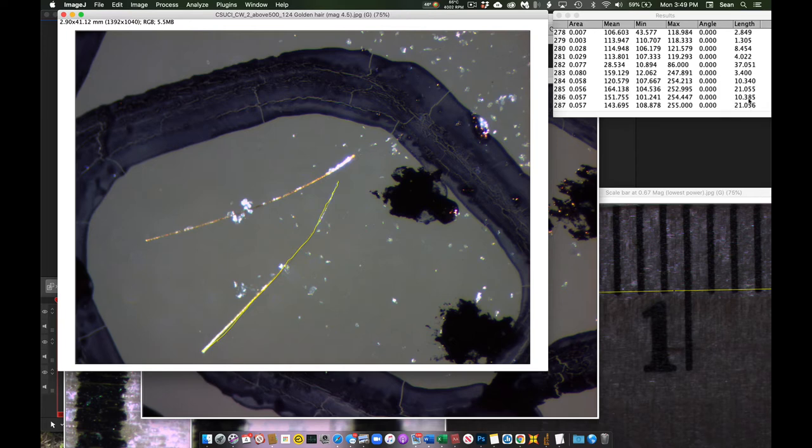And so I'm concerned that this might have introduced a significant amount of error to our microplastics measurements of late, at least mine on this computer. And I'm not entirely sure what's going on. I've checked the forums, but I can't find a ready answer for why getting such massively different values for these similar length fibers.